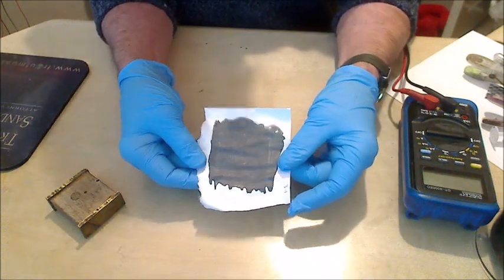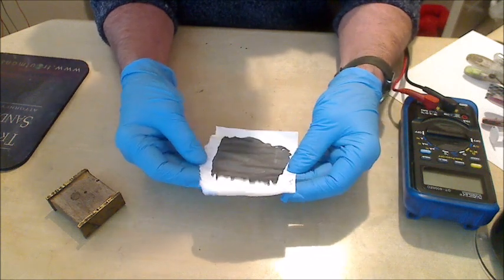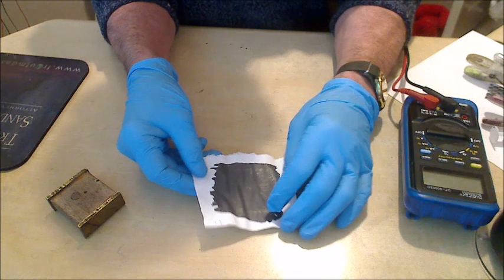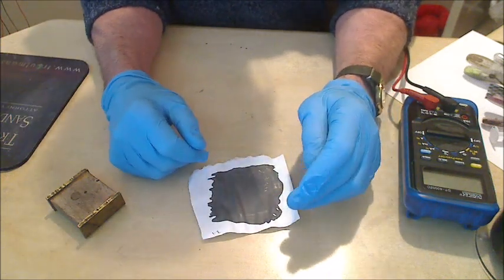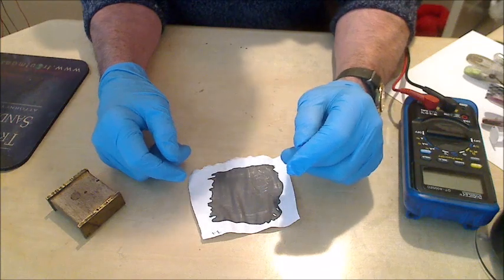If this was graphite, there's no binder in this, so it would just fall off the paper. If it sticks to the paper, it tends to be, in my belief, platelets of graphene. I don't know how many layers. It could be 1, it could be 100, it could be 1,000.